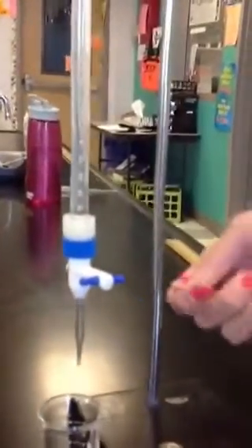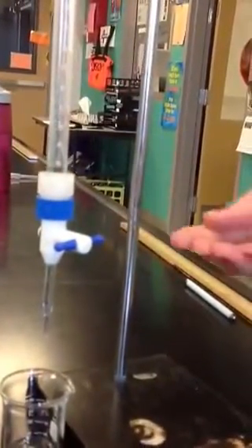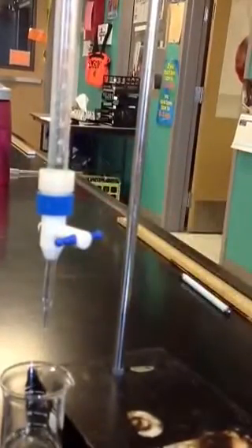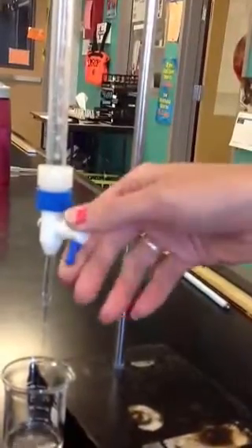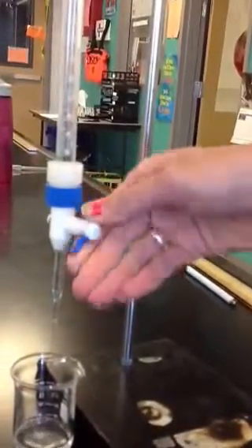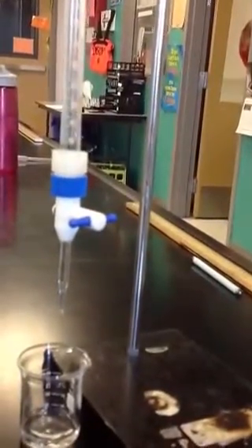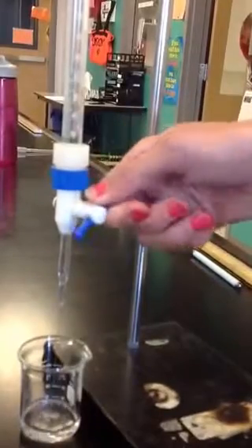The other thing we want to talk about is how a burette works. If your spigot is horizontal, it's closed. If it's vertical, it's open. From the very first lab we did this year, people sometimes panic and end up just turning it back and forth, opening and closing it. This is a very particular lab, so just remember: horizontal is closed, vertical is open.